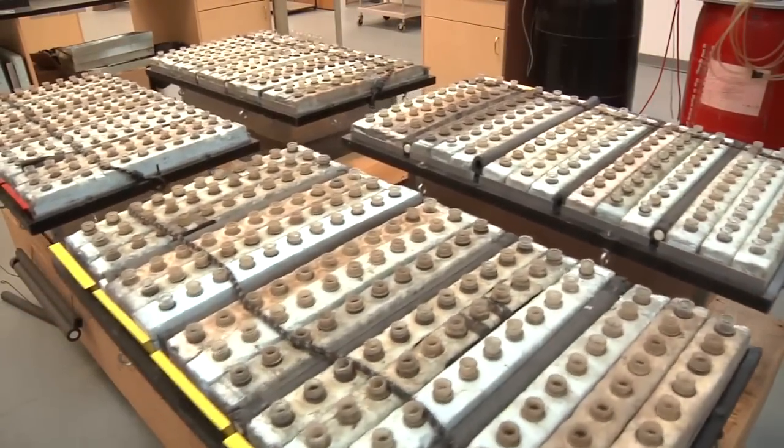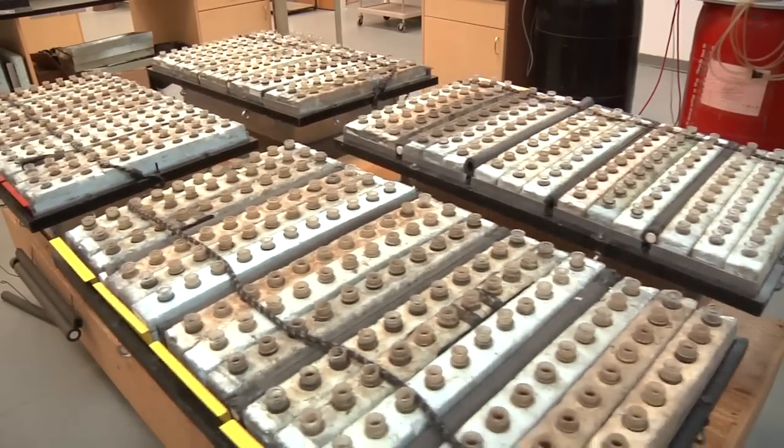Then we shake the samples for five minutes to two hours, depending on the extractant.